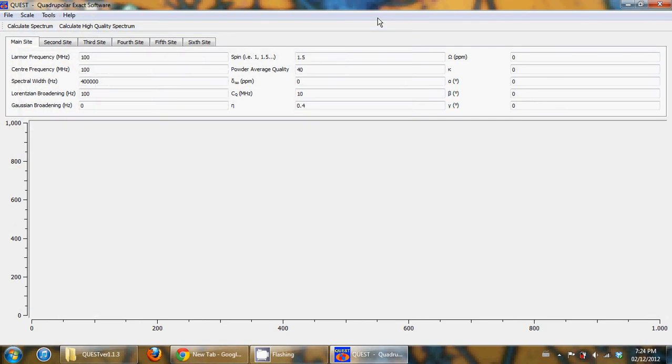Additionally, I've made a major speed boost in Quest. So the way that the powder averaging is done in Quest is that you separate space into a bunch of different triangles, and you do a linear interpolation, and you have to step through all the different data points in your spectrum and calculate, okay, what's the intensity that you should have at this part of the spectrum.